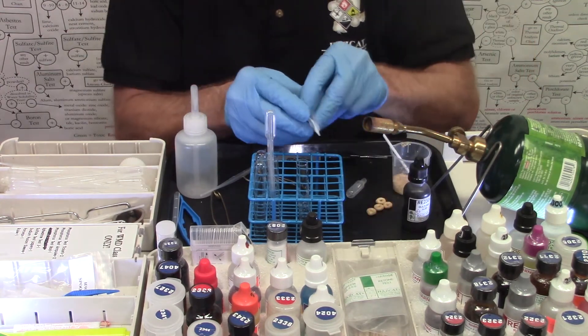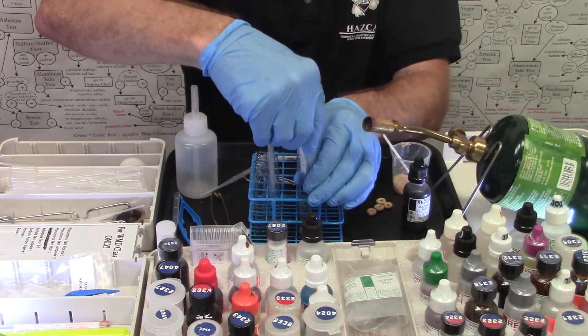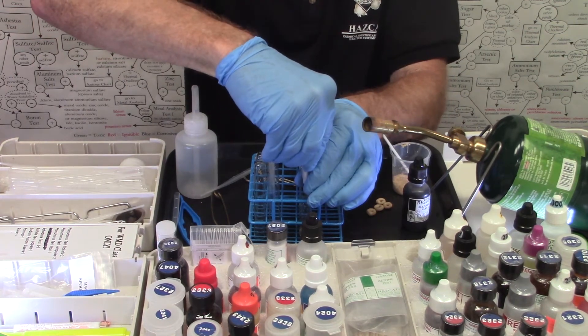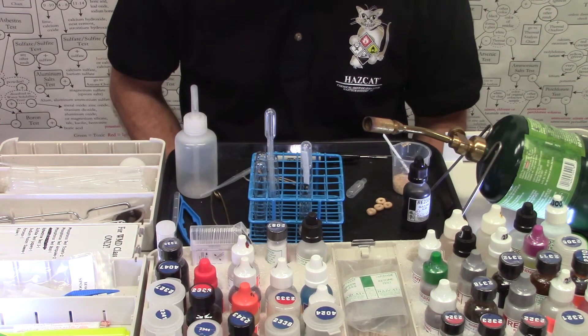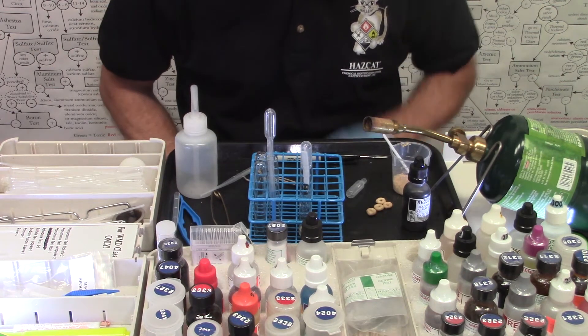We're going to take that bulb that we set aside, shove it into the top, make a nice tight seal with it. And now we wait for five minutes. I'll be back in five minutes. Let's see what happens.